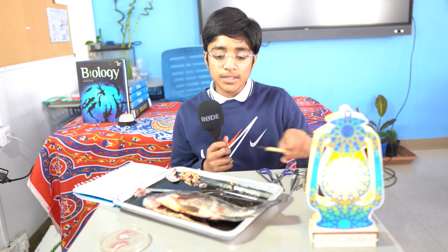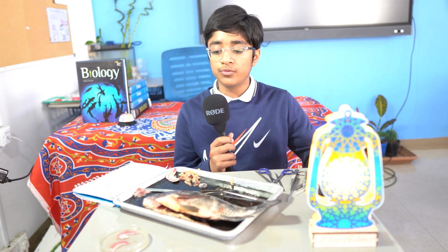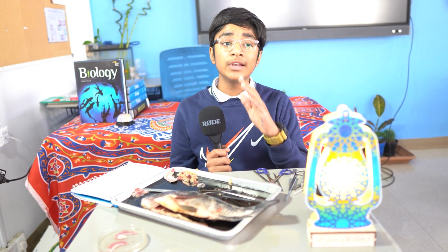This fish also has a wide range of scales at the top, which is really useful for its defense as well as to protect the skin. And underneath it, it has a lot of layers of fat. And this fat can really help to insulate it so it can be safe from many temperatures.